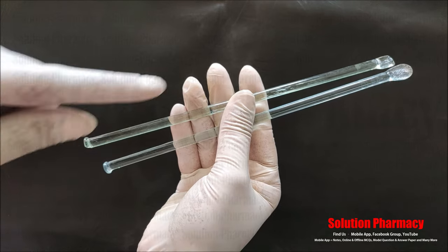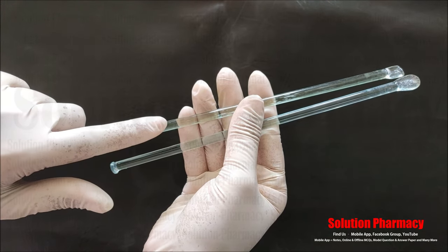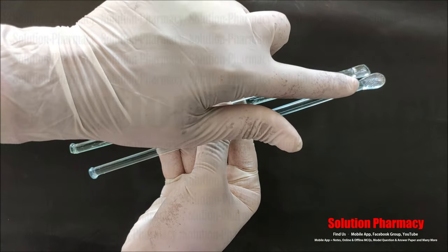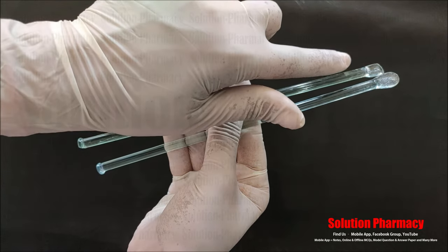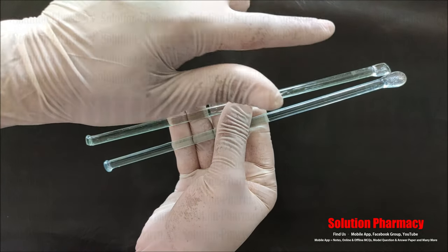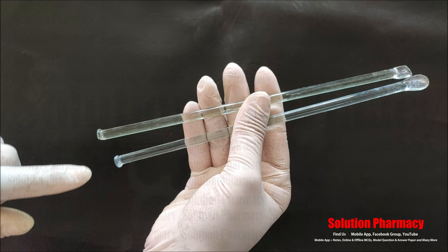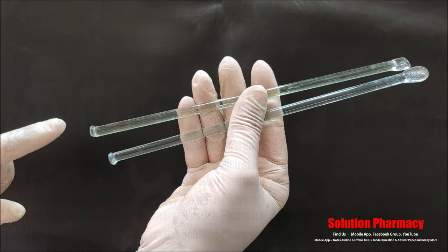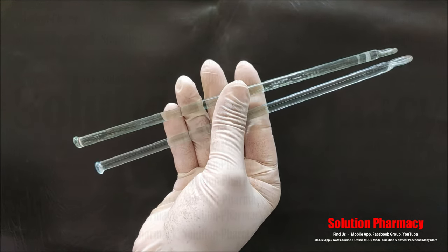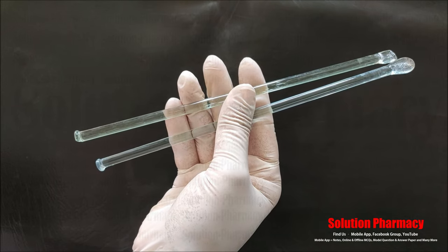Next, this glassware is called a glass rod or stirring rod. As the name suggests, we use it to stir. If we have to make a solution we mix solute and solvent and stir it using this glass rod.